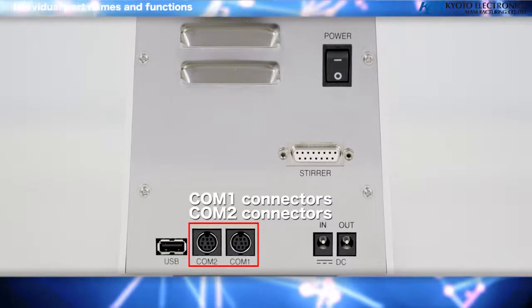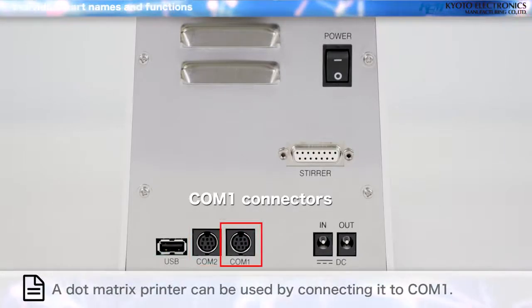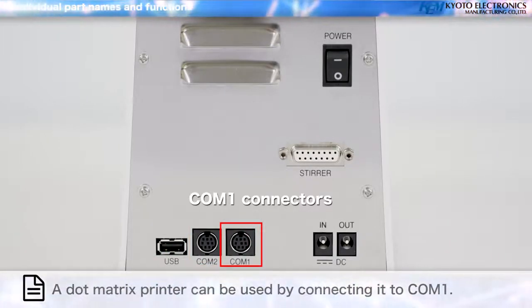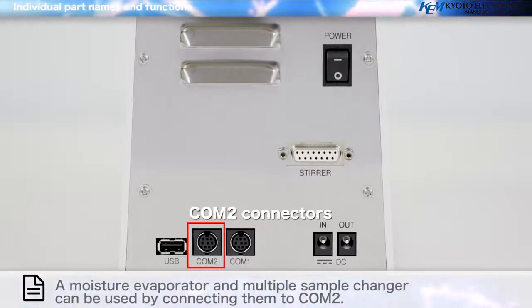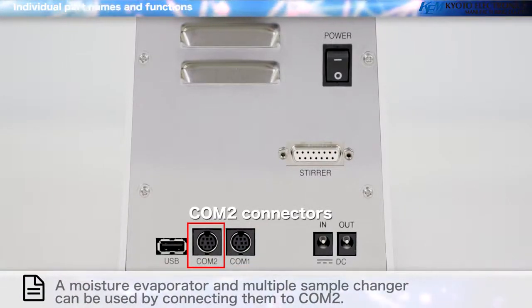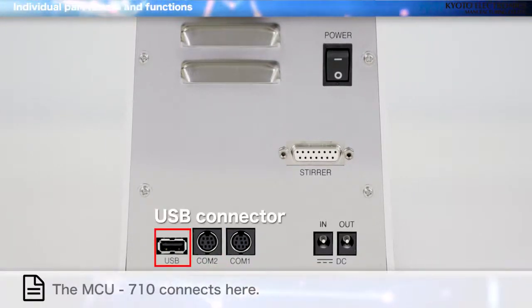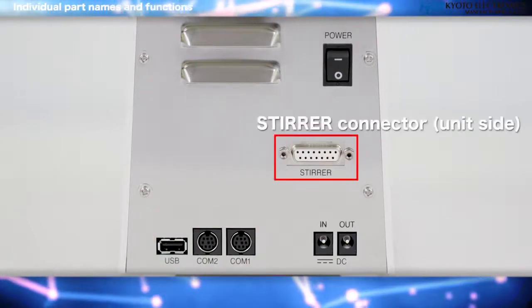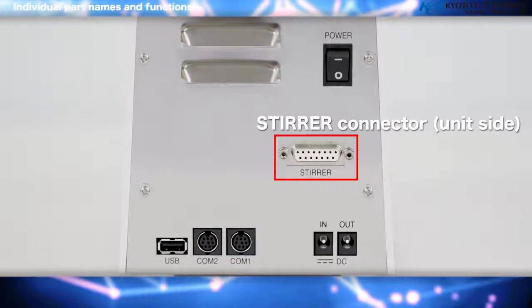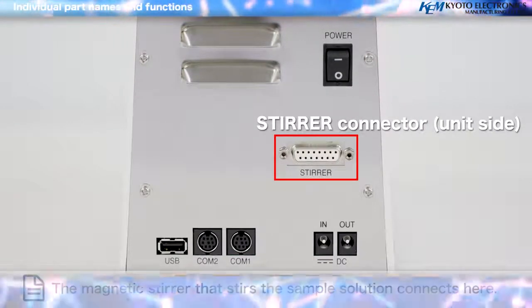COM1 and COM2 connectors. A dot matrix printer can be used by connecting it to COM1. A moisture evaporator and multiple sample changer can be used by connecting them to COM2. USB connector. The MCU710 connects here. Stirrer connector, unit side. The magnetic stirrer that stirs the sample solution connects here.